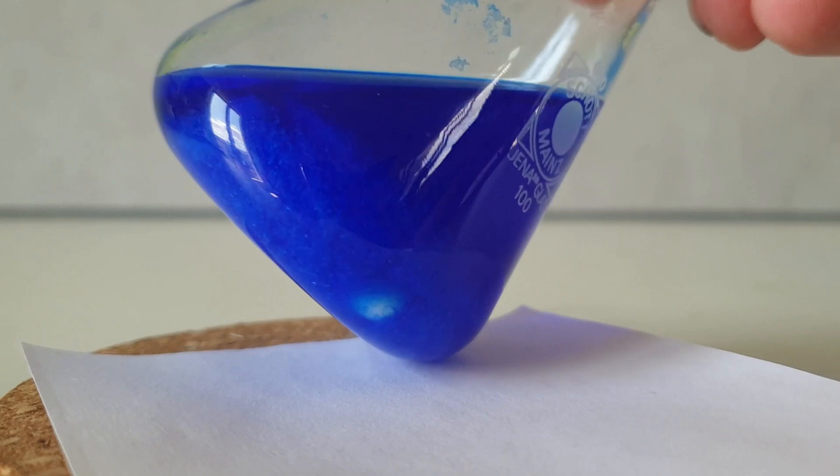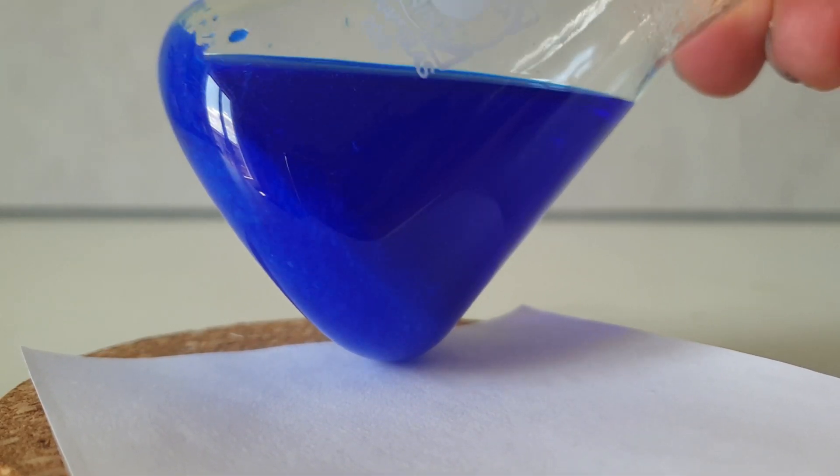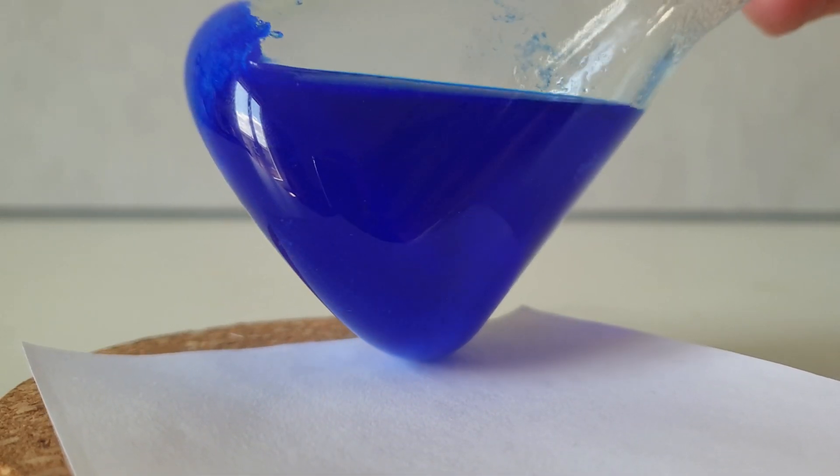Initially, some bigger chunks of our compound crashed out of solution. And upon standing for 30 minutes, a large amount of tiny needle shaped crystals had formed.